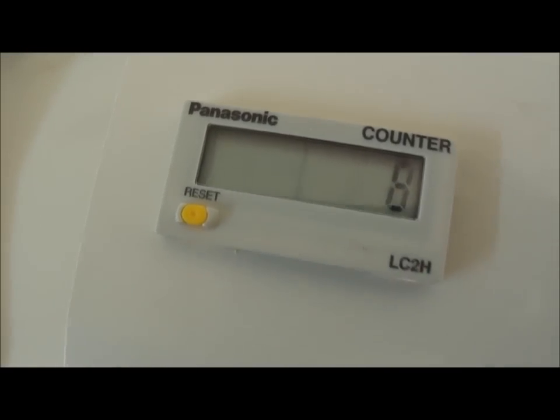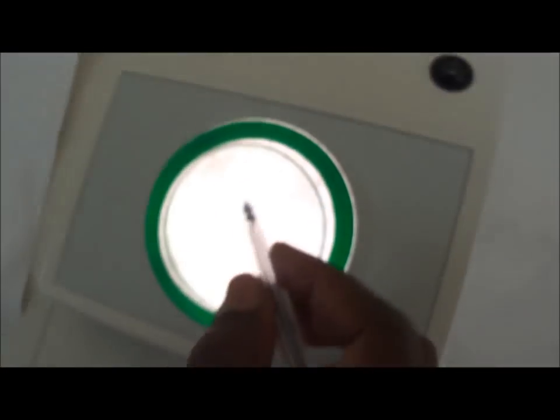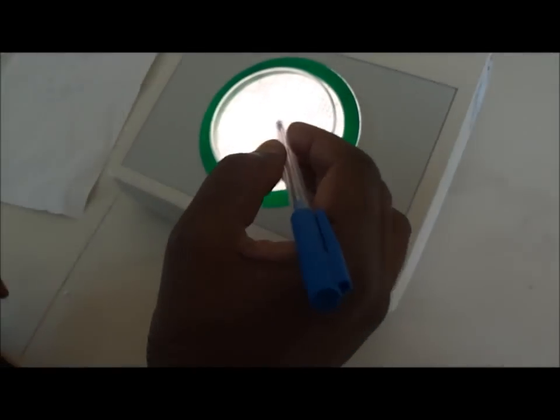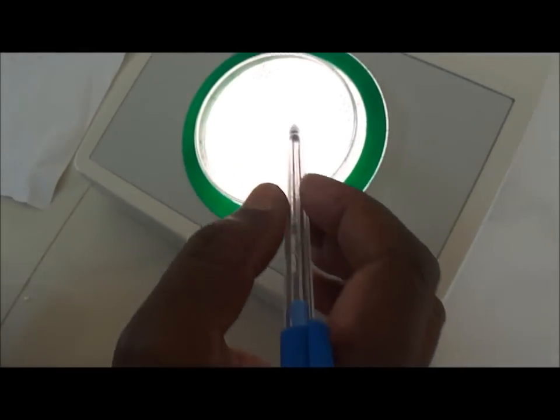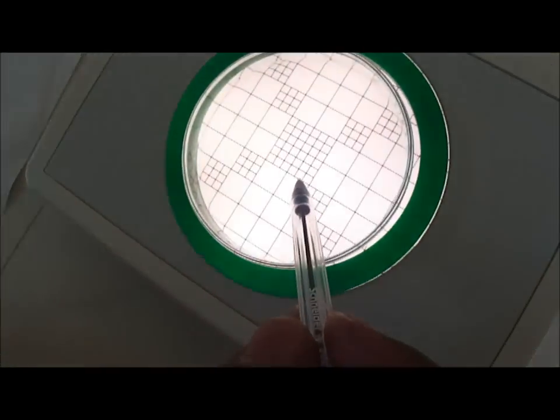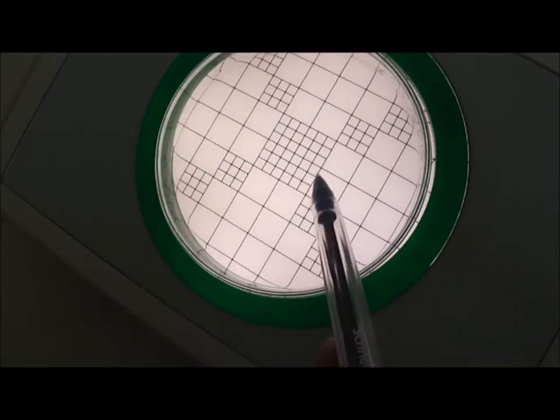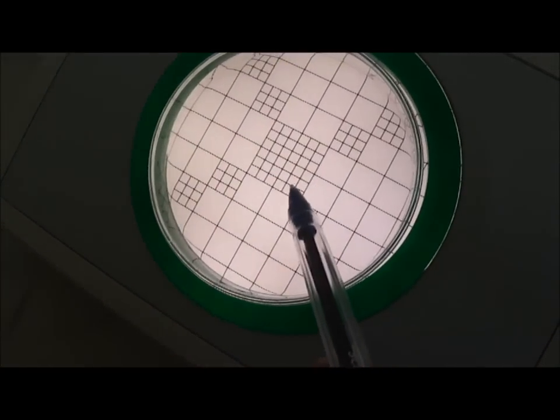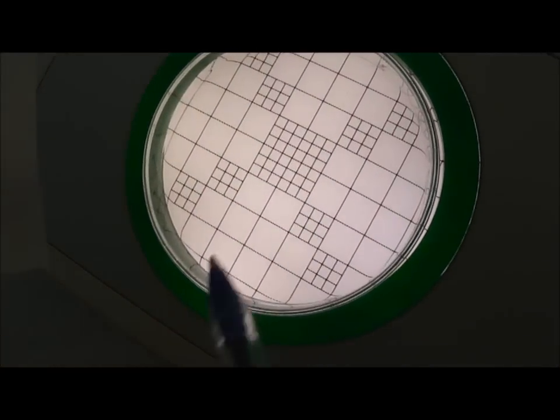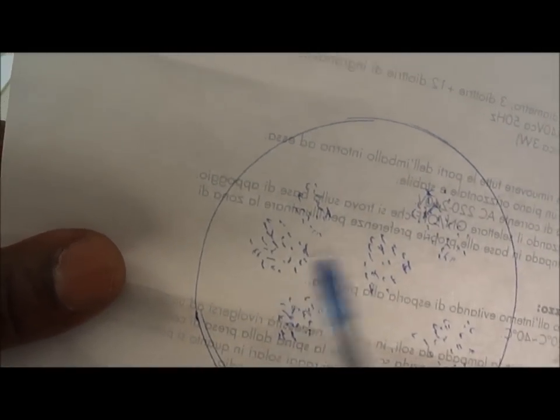Now, the frames inside here are making it easier to distinguish the boundaries of your groups, the bacterial colonies, the boundaries of the groups, as you see here.